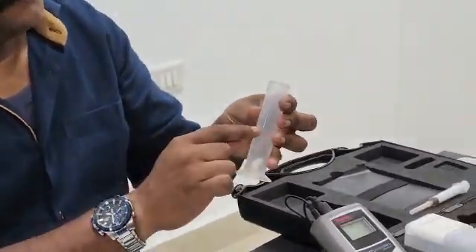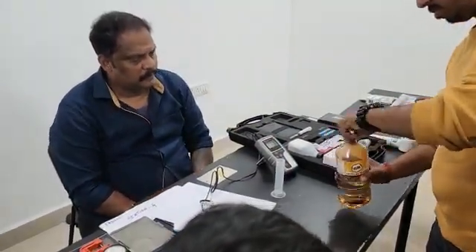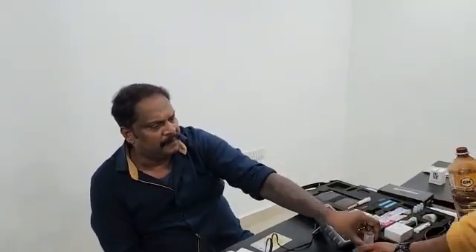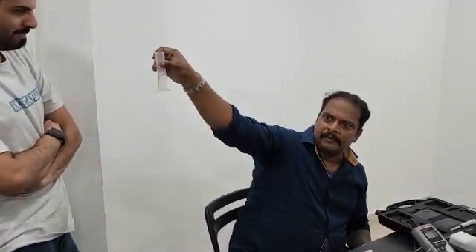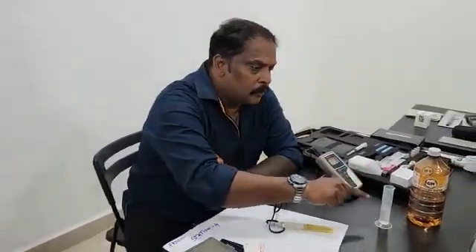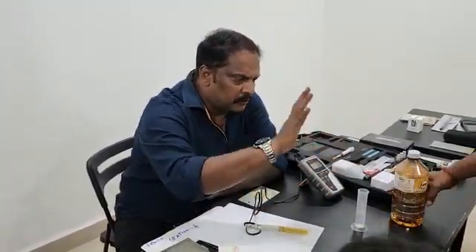Don't touch the probe with your bare hands. Fill exactly 15 ml of water here — 15 ml only. For this test it is mandatory to use 15 ml. You should not waste any water, no leakage, no drops, otherwise your test interpretation and values may change.